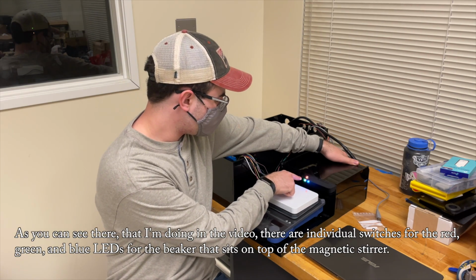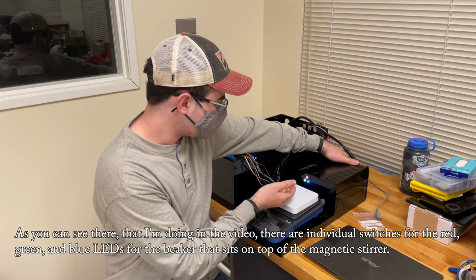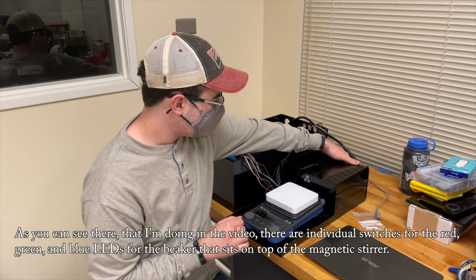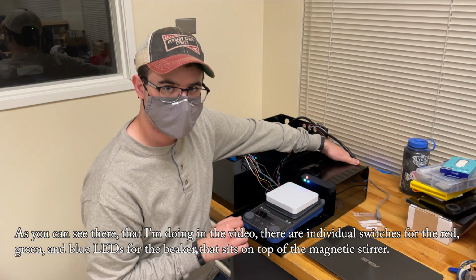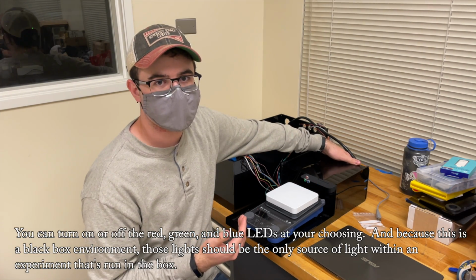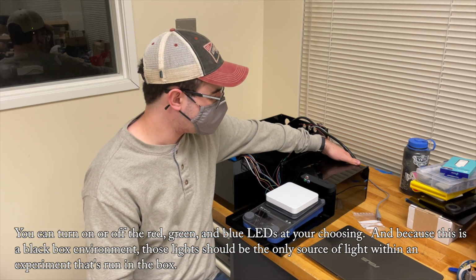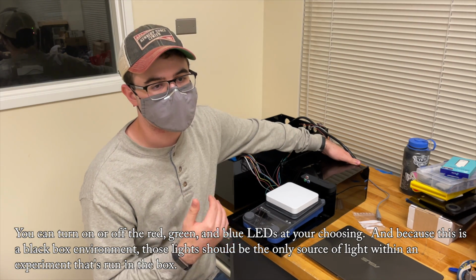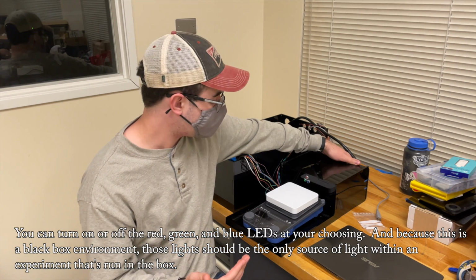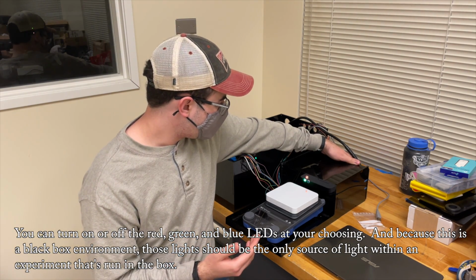As you can see in the video, there are individual switches for the red, green, and blue LEDs for the beaker that sits on top of the magnetic stirrer. You can turn on or off the red, green, and blue LEDs at your choosing. And because this is a black box environment, those lights should be the only source of light within an experiment that's run in the box.